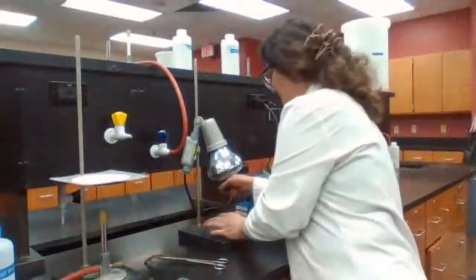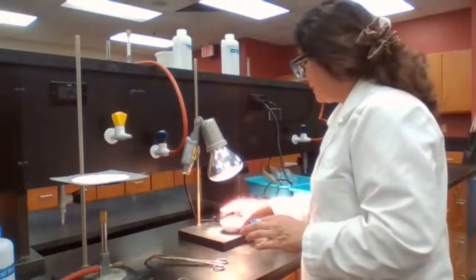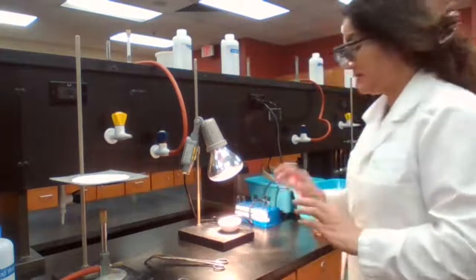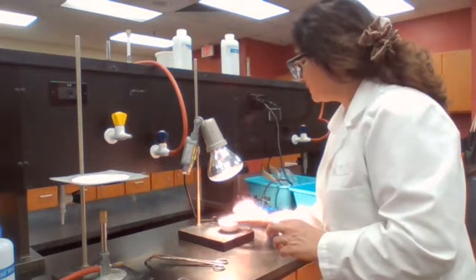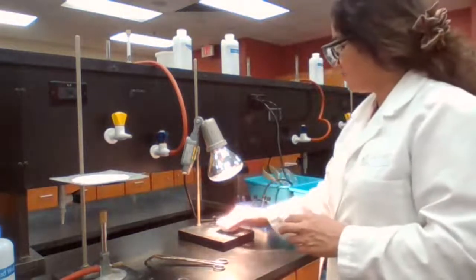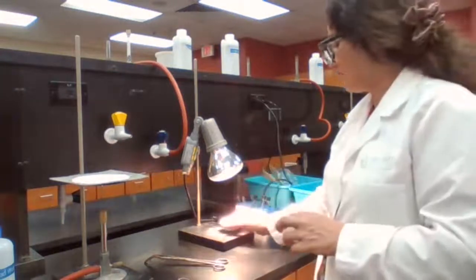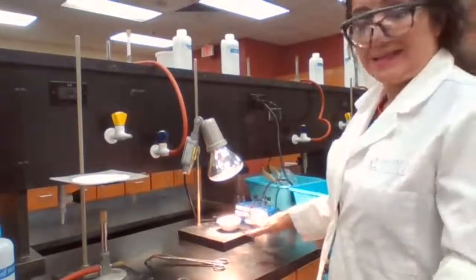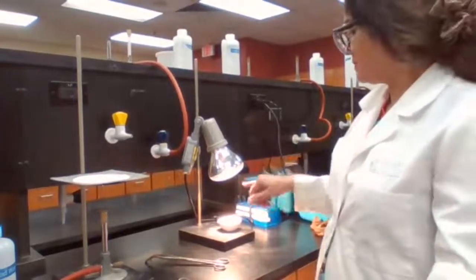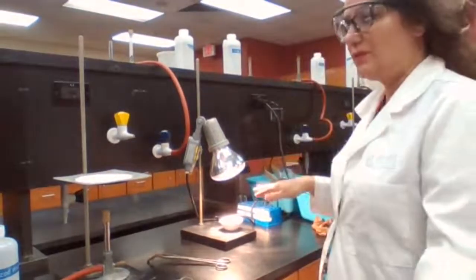Going to turn on the heating lamp and place the evaporating dish under the heating lamp until it's dry. When it's dry and I try to move the zinc, the zinc particles are going to move around. When it's wet, the zinc particles are kind of clumped together and they are not moving around. That is the last step for part one of the experiment, because we want to get the mass of the unreacted zinc. So we are waiting for that.